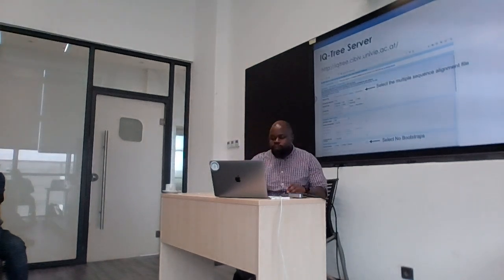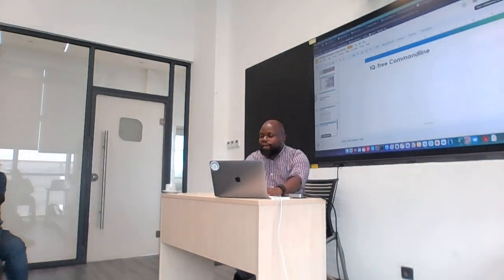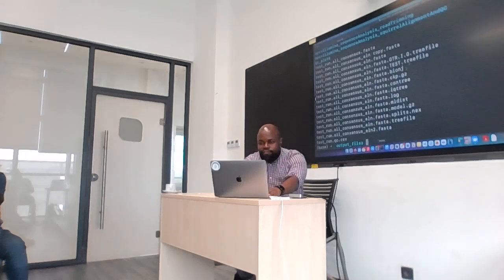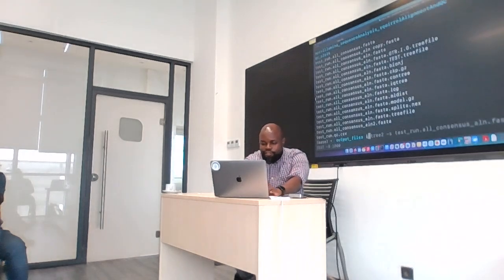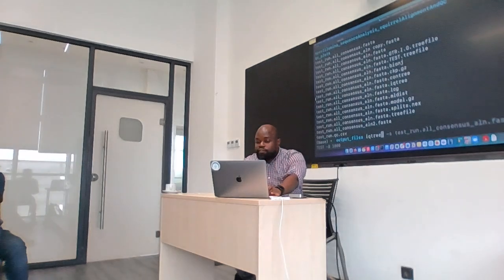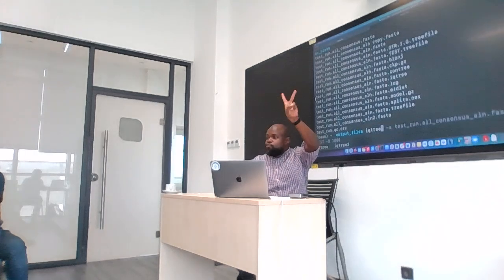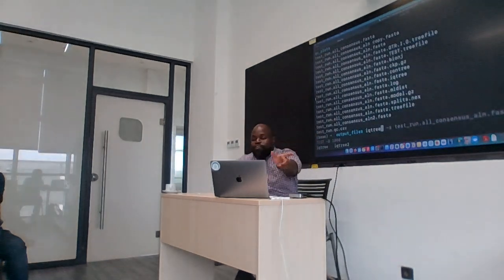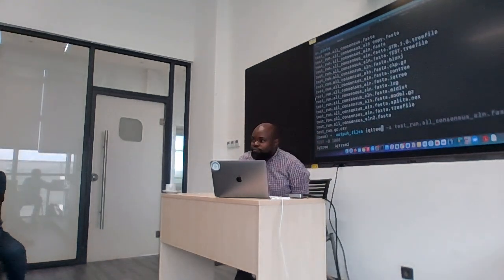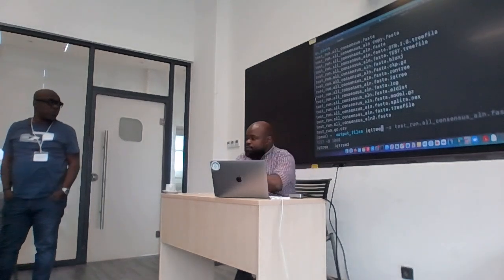Okay? Now the other option that you're going to use is the command line. So we've installed IQ-TREE. So if you check through your installation, if you just type iqtree, can you tell me if you see two versions, iqtree and then iqtree2? Type iqtree, then you tab and see what happens.